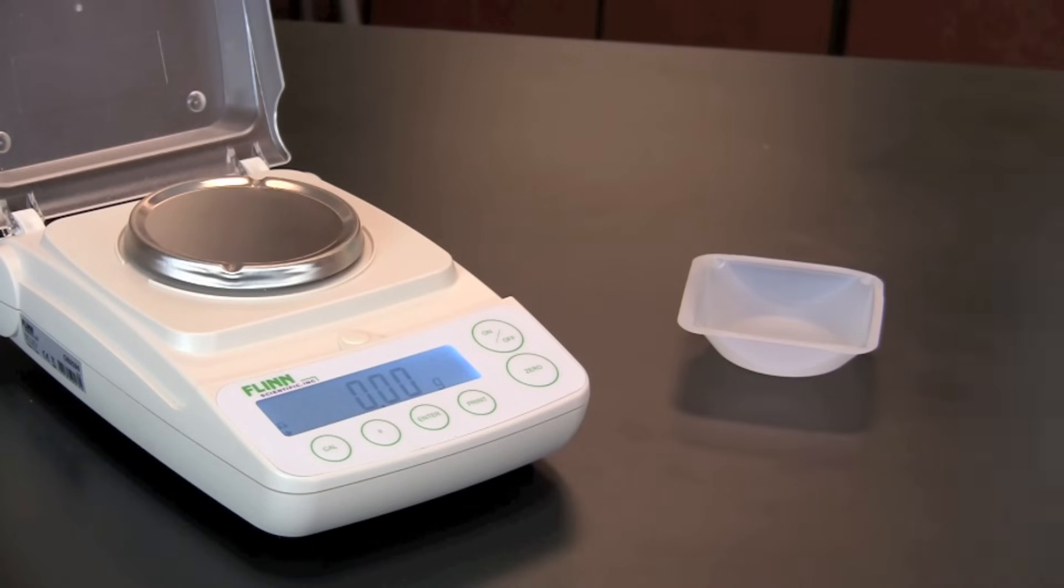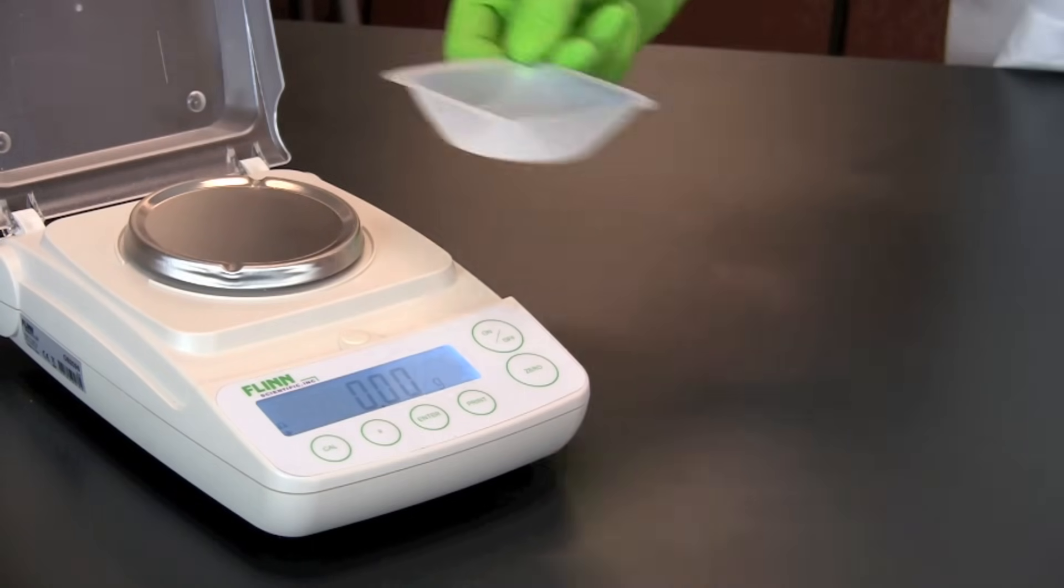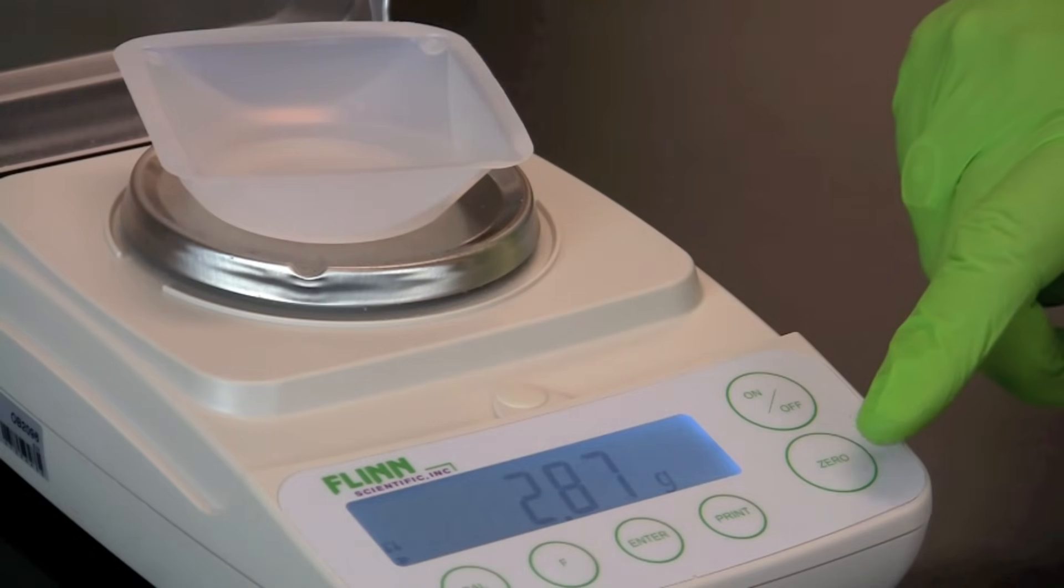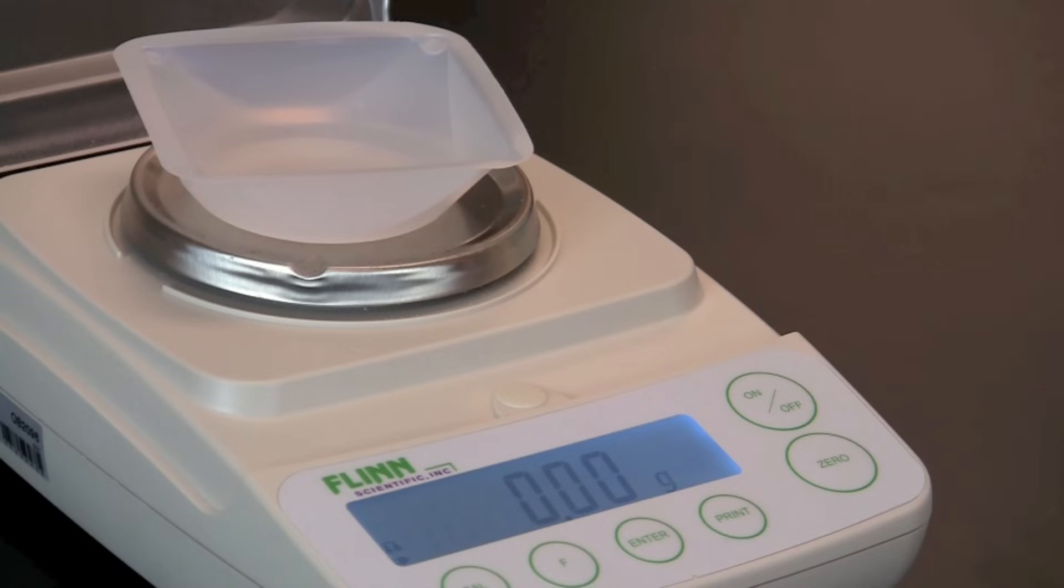Next, place a clean weigh boat on the balance. And when the reading has steadied, set the balance to zero with the weigh boat.